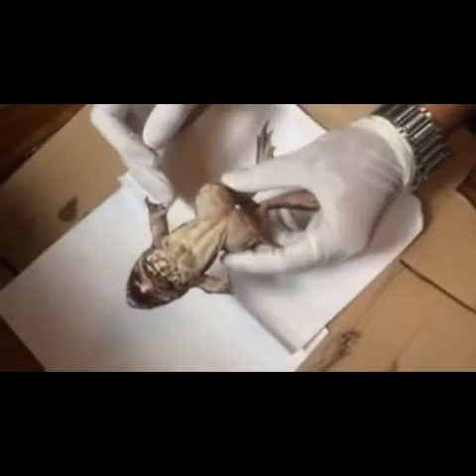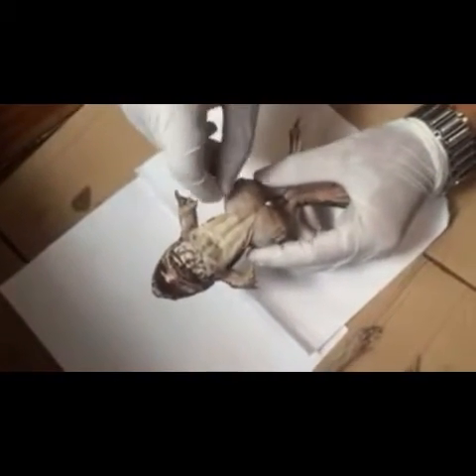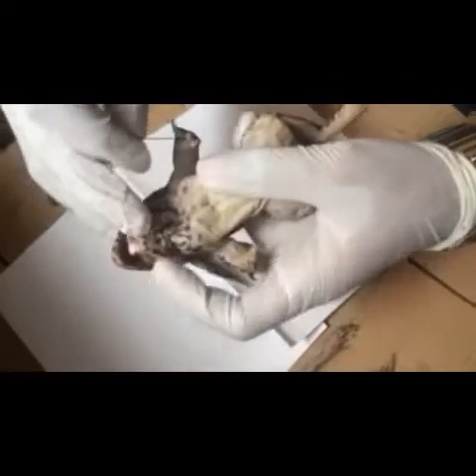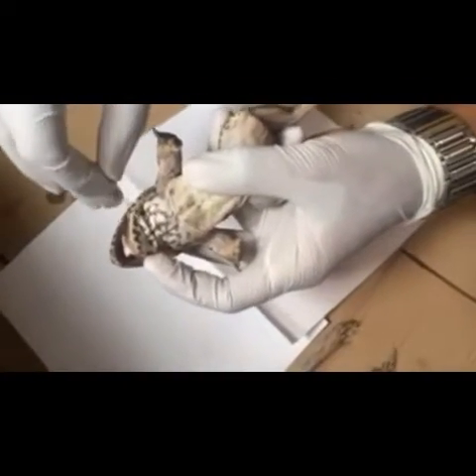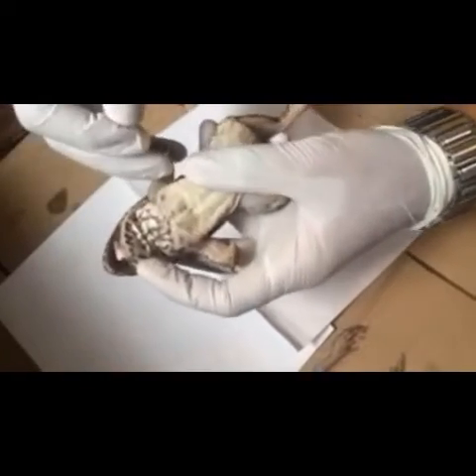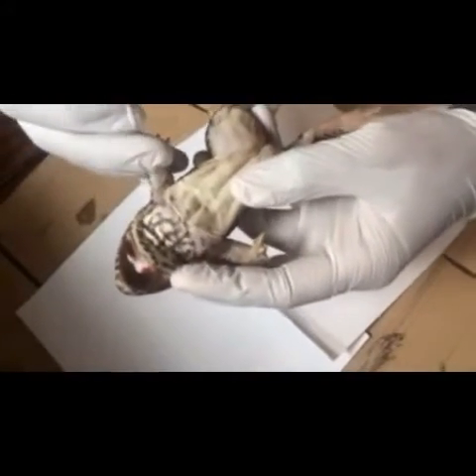Okay, that's all for dorsal view. In the ventral view, this is the abdomen. And if you can see it, it has a darkly pigmented skin and it has a swollen thumb. So we can conclude that this is a male.